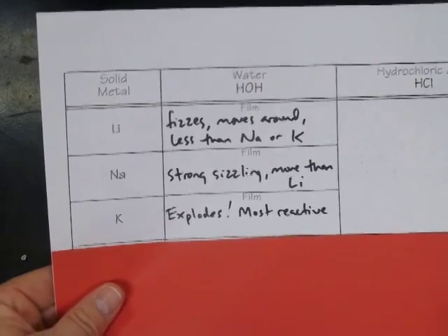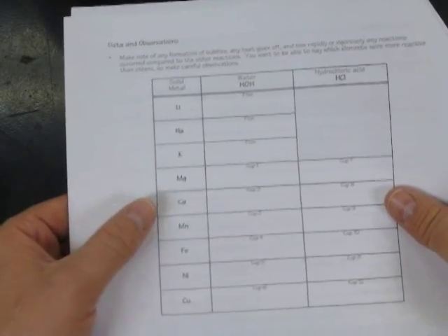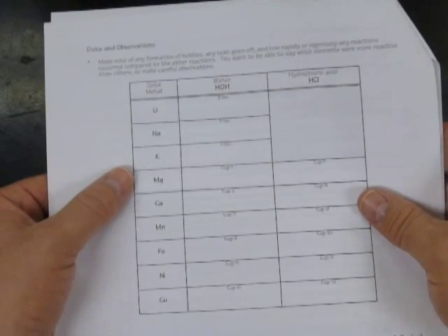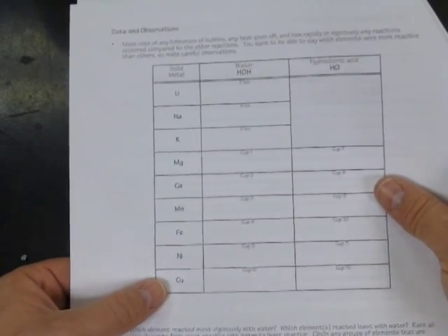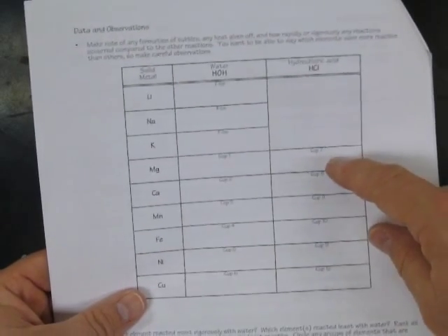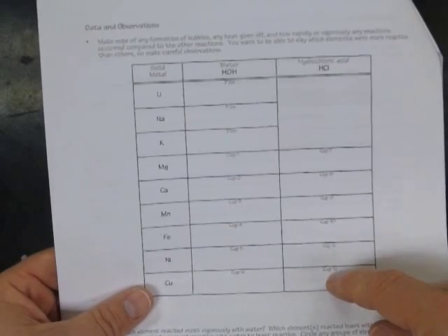Our goal is to compare how reactive the different metals are, looking at lithium, sodium, potassium, magnesium, calcium, manganese, iron, nickel, and copper. I'll show you a demonstration video of the last six metals that were tested at the lab benches by combining them with water and hydrochloric acid to see how much fizz and how much heat they made.